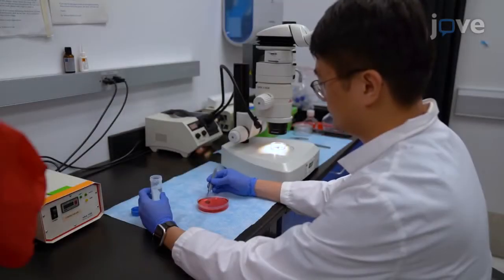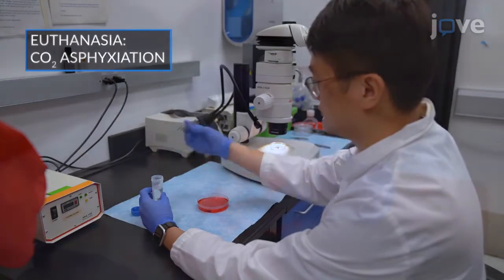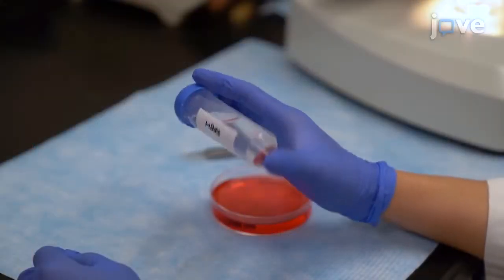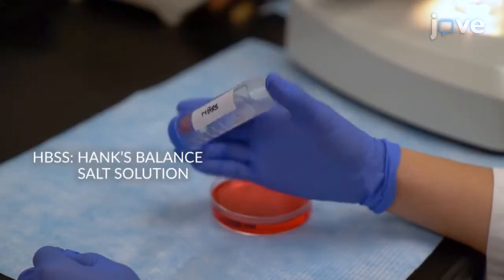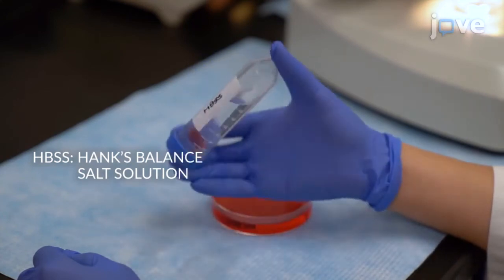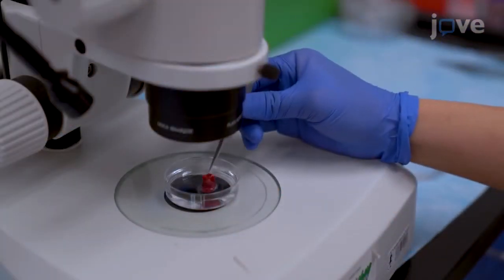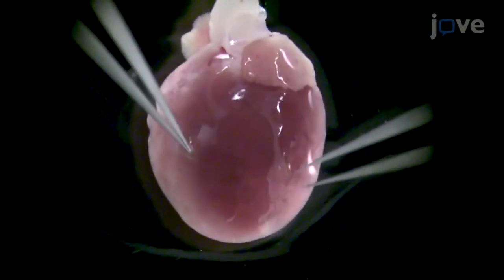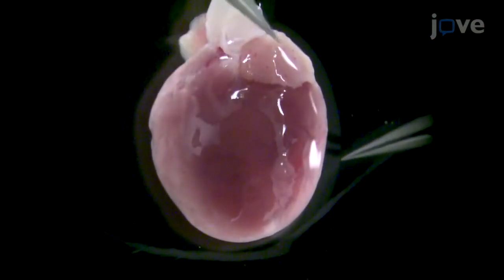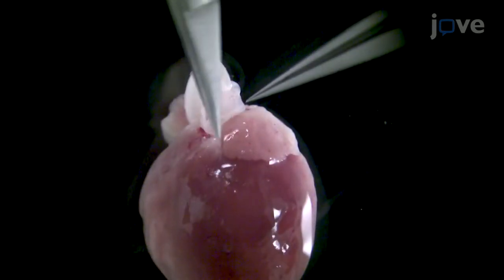After harvesting hearts from six 50 to 100 gram Sprague-Dawley rats, wash the organs with 50 milliliters of cold HBSS three times to remove any excess blood, and place one heart under a dissecting microscope. Position the heart on its flatter posterior face to identify the left and right sides of the tissue and locate the pulmonary artery.